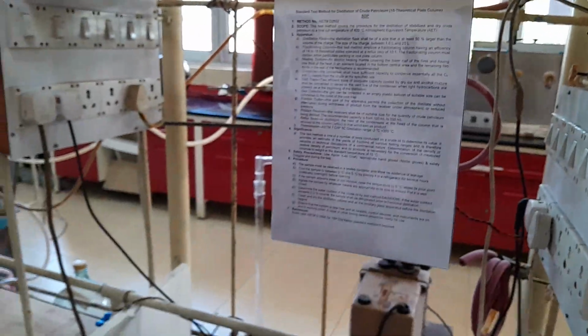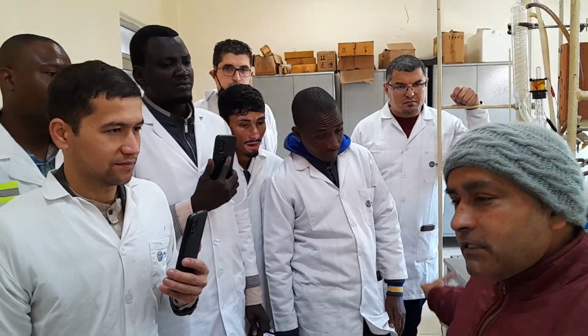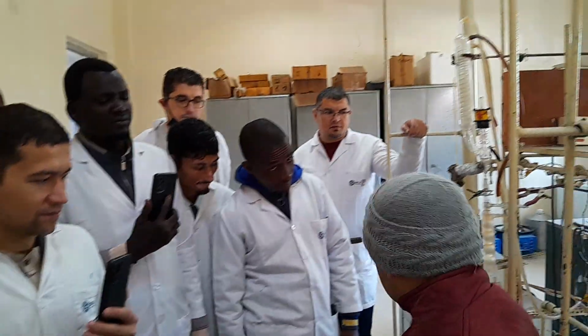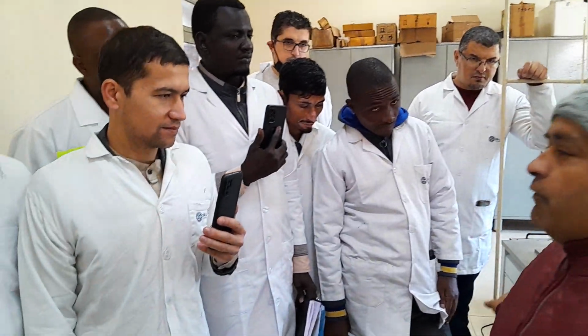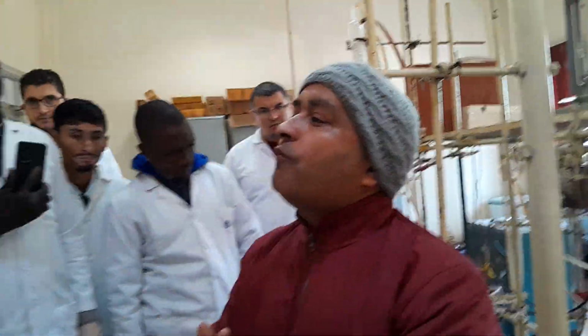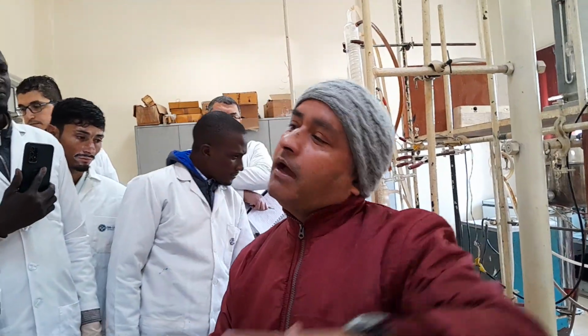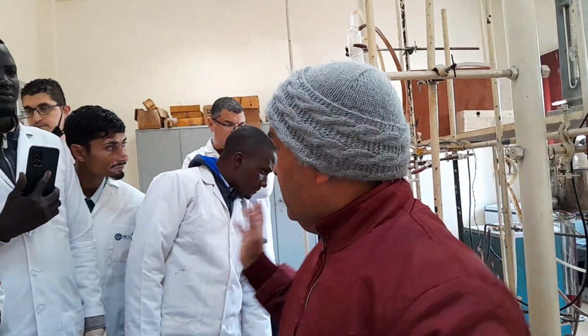What is the reason? Because D86 is not a fractional distillation and this is a fractional distillation. That is why it is also known as a TBP, meaning this unit gives you the true boiling point. But D86 does not give a true boiling point because it is non-fractionating distillation. So with a non-fractionating distillation, obviously the IBP will be higher than the IBP of the fractional distillation. This is the first question's answer.